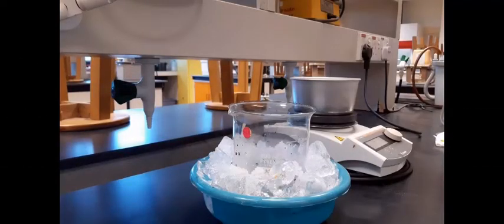After cooling the sample in an ice bath, we shall filter off the dark compound by using suction filtration. After that, we will wash the product with ice cold water. You may want to know why we rinse the product with ice cold water and not normal room temperature water.